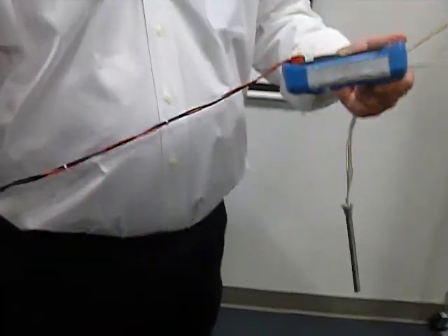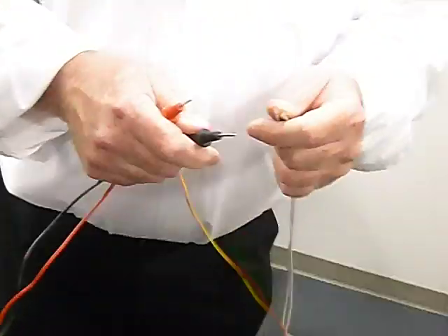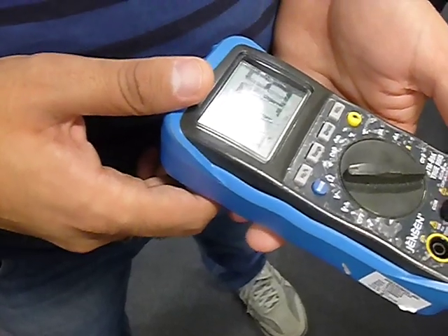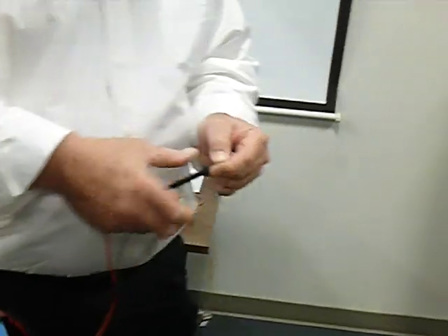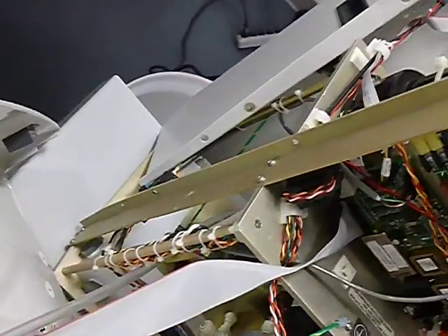All right, I usually just put my multimeter here. You want to hold that? Go like this. About 17.6, 18 ohms. Thank you. Depends on temperature, right? Yep. It changes the resistance. Usually when I do that, I just take this off right through here, and I put a paper clip and I measure the resistance on it. Okay?